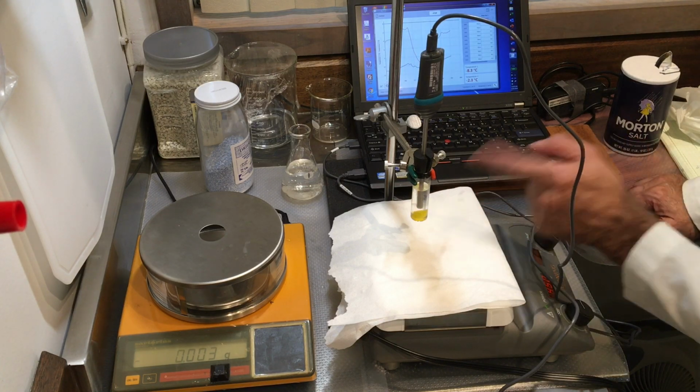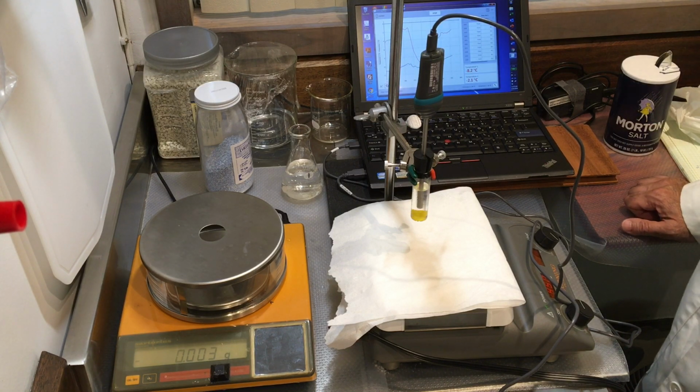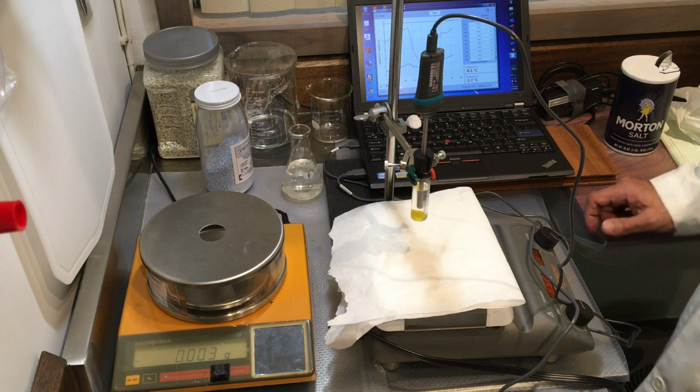Okay, there's just one piece of ice in there. It's almost melting completely. So once that ice piece is melted, you'll see a more rapid rise in temperature. Right here. Okay, so liquid now.